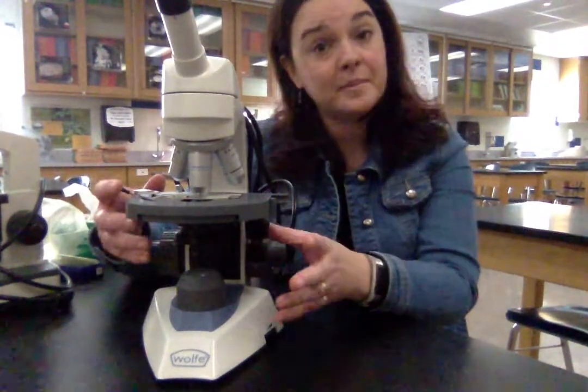When we're all done with the microscope, with COVID protocols this year, we're going to make sure we're wiping off all the touch points. Your teacher will make sure the knobs and anything that was touched, like the stage, are wiped off with disinfectant. It's really important that you're not touching the eyepiece at all — not with your eye, not with your face or hands. If that happens, let us know and we'll take care of it. We're not going to cover the microscopes when done so we can wipe things down quickly.